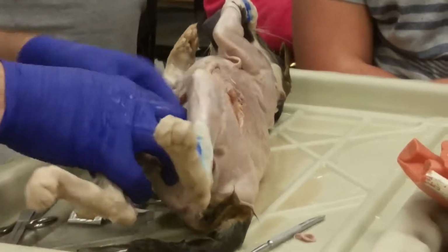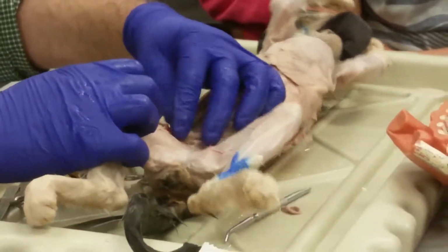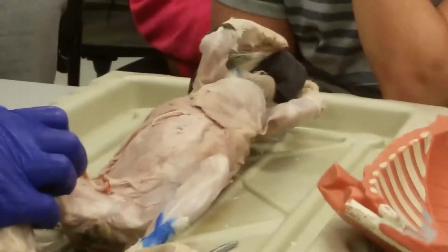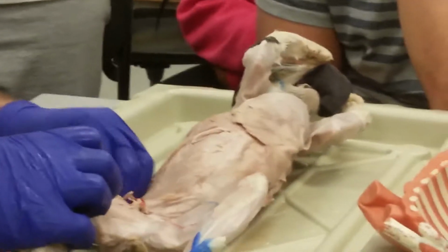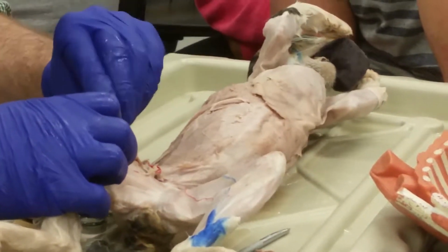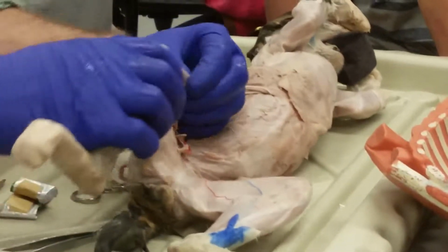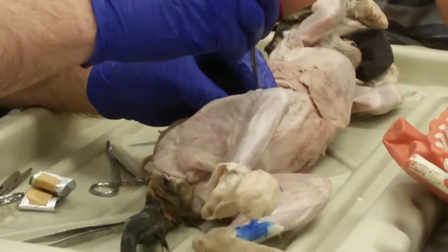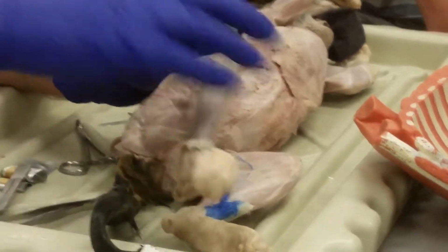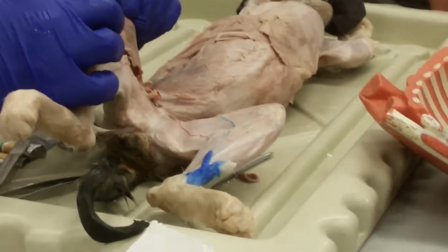Okay, so like the following. We started to work on the anterior thigh here, and we see this broad flat muscle going from the lateral aspect, crossing over the thigh and inserting into the medial side here, going into the tibia.